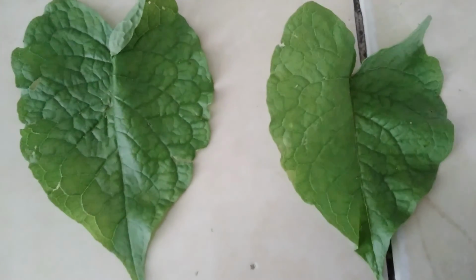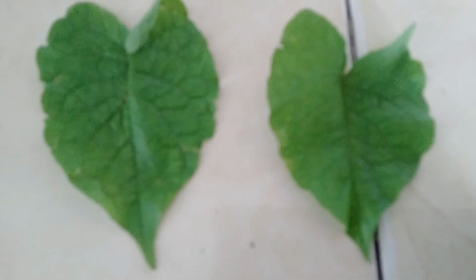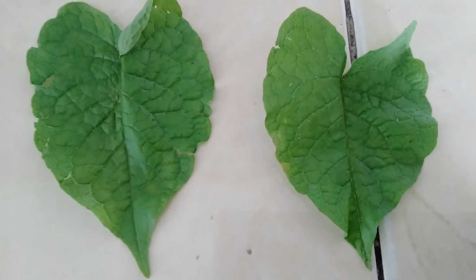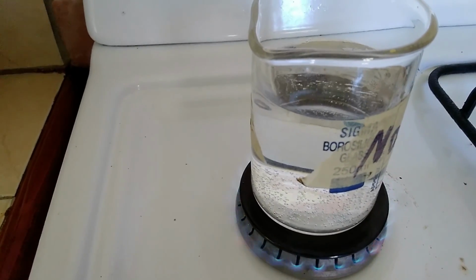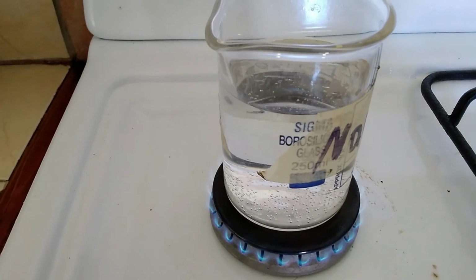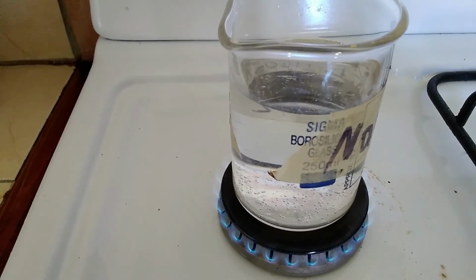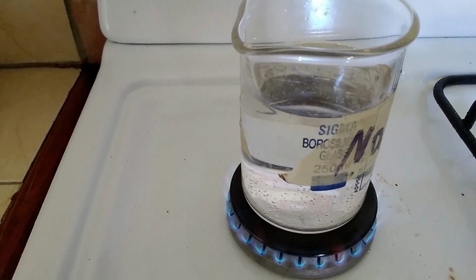Now this leaf will also be used in our drawing lab. So pay attention to both leaves. One is variegated while the other is not. All right. Due to COVID, I'm home. I'm actually doing the lab from the stove in the kitchen. I actually got a beaker to borrow from school. So we're doing the lab at home so that our students can have an appreciation.